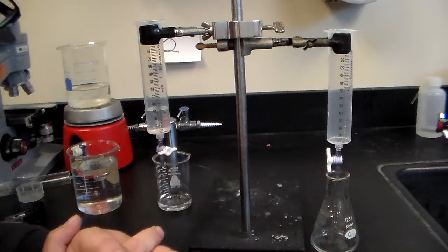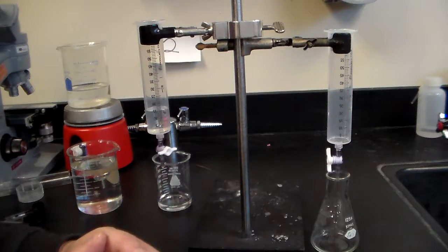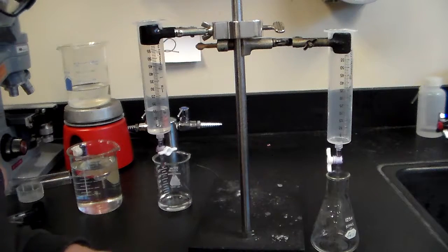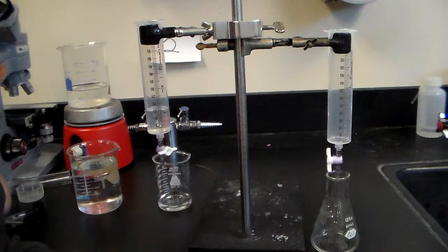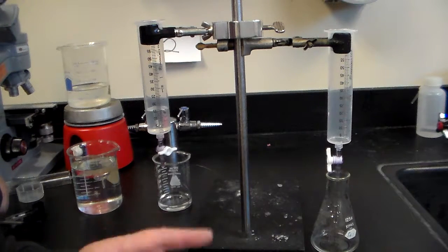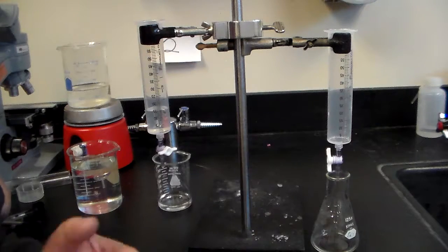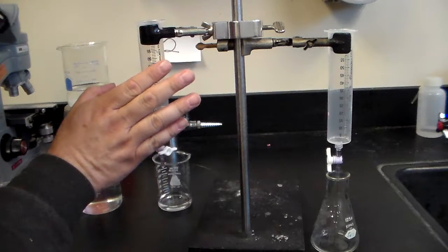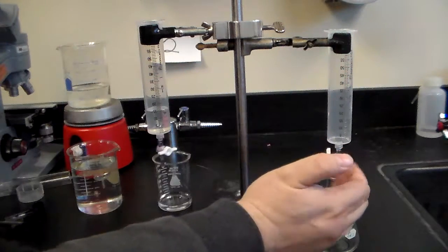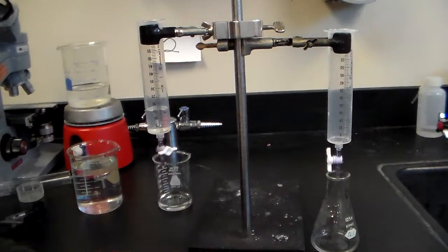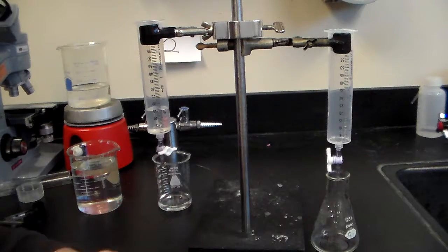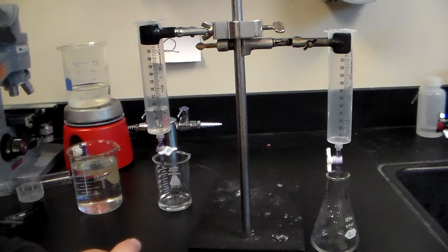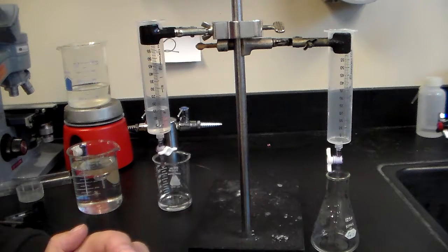What are you looking for? We're looking for neutralization. Because it's a strong acid and a strong base, they are both monoprotic, meaning they give off one hydrogen. The nitric gives off one hydrogen, the base has one OH in there. That's going to be very straightforward. Our pH at the end point is going to be seven.